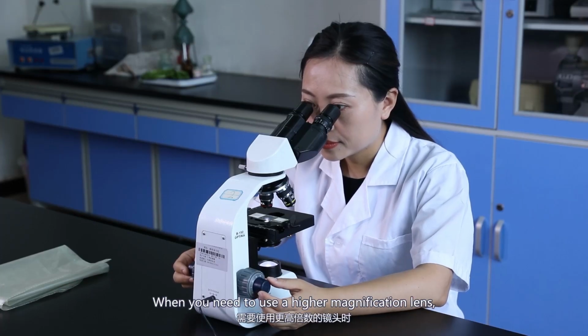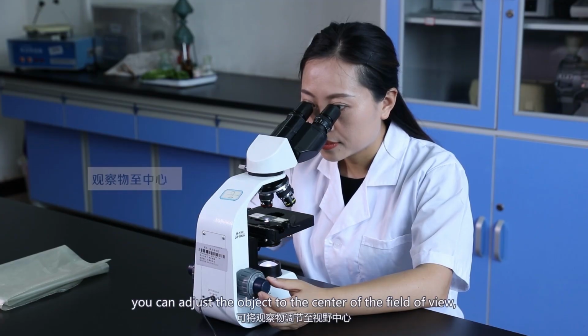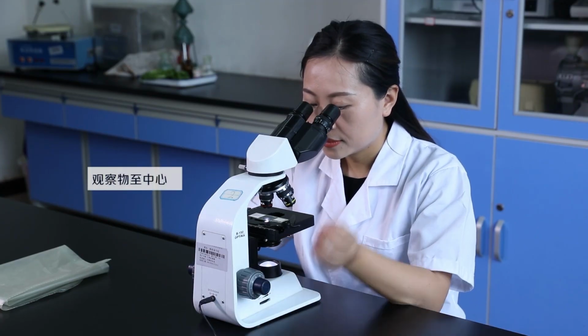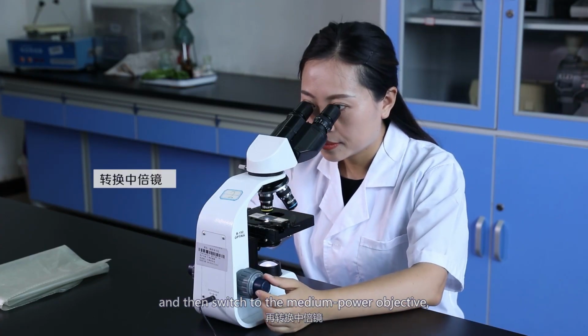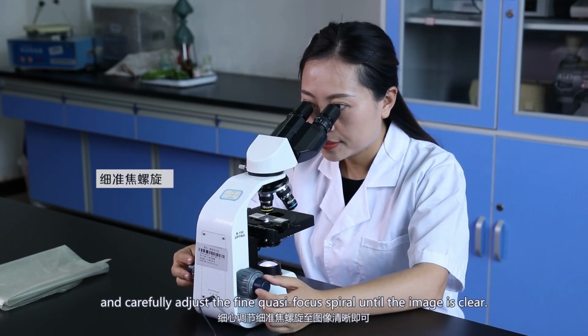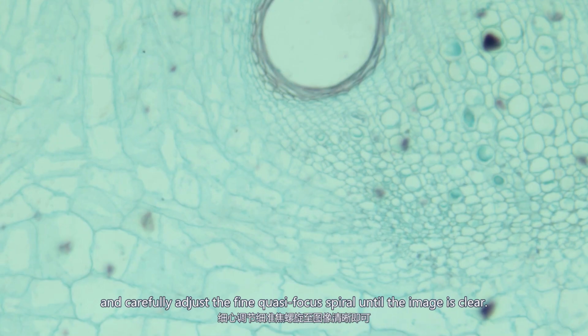When you need to use a higher magnification lens, you can adjust the object to the center of the field of view, and then switch to the medium power objective, and carefully adjust the fine focus spiral until the image is clear.